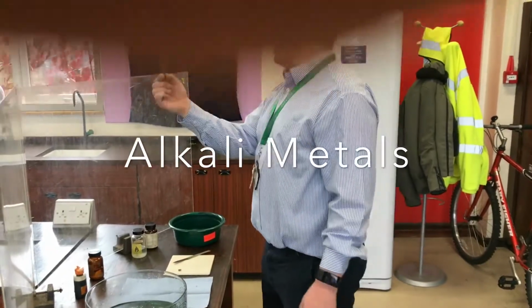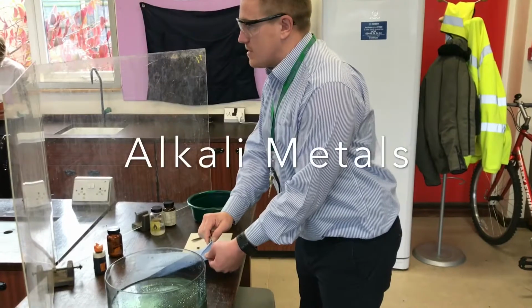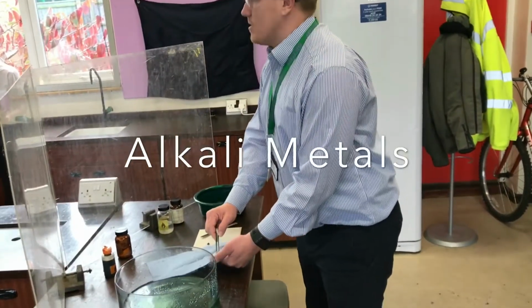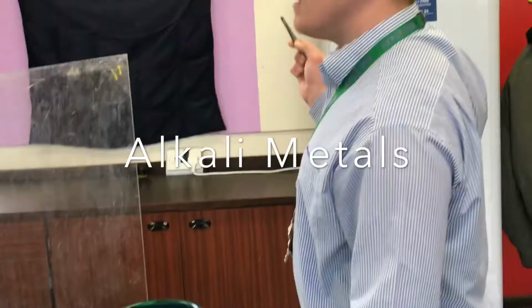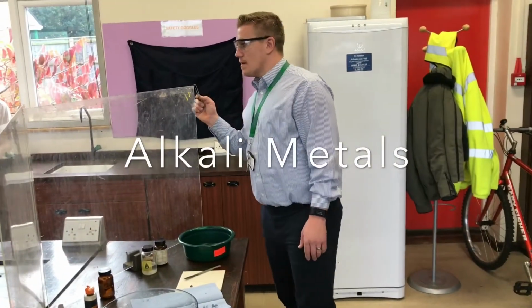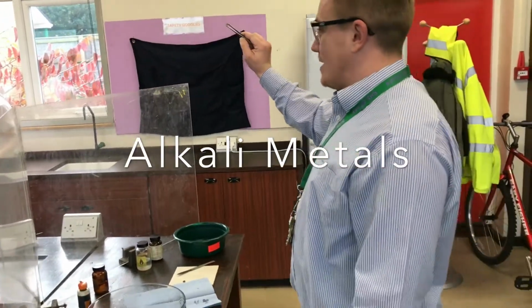Alright, and it stays quite shiny, it's not reacting with air a lot, even when I dampen off the oil that is securing it in suspension from water so it doesn't react. And now guess what's happened as soon as it's hit the air? Who wants to have a guess? Yep. It's gone dark. It's gone dark grey. So it's reacting with air. You can put that in your description.